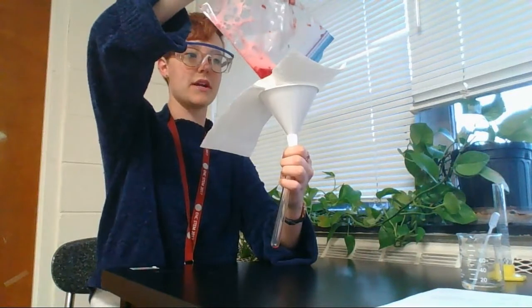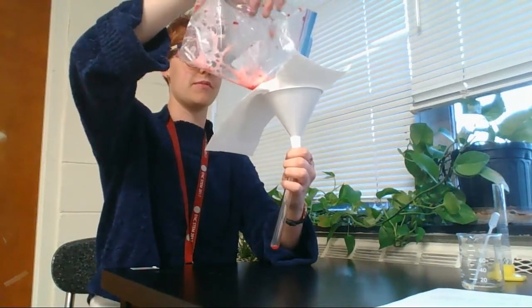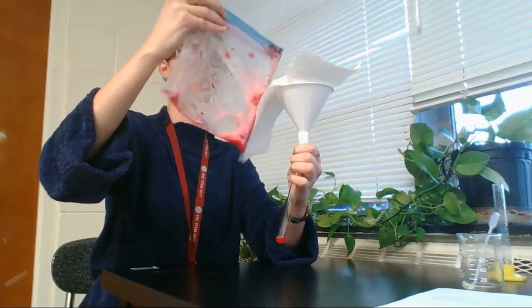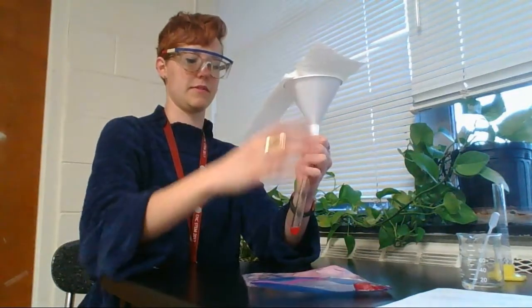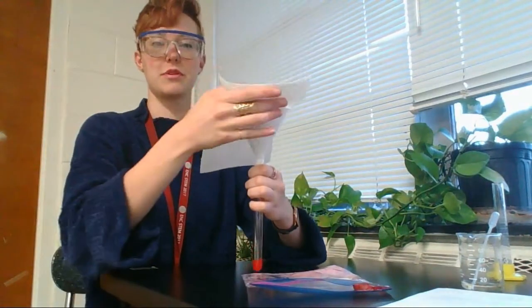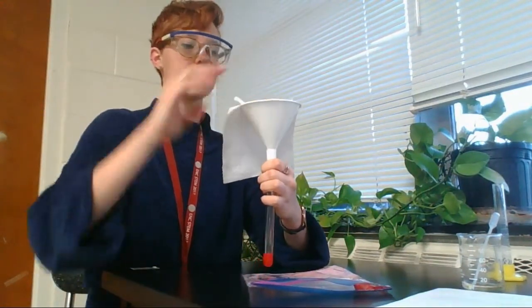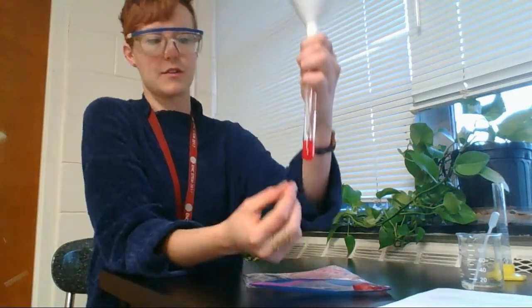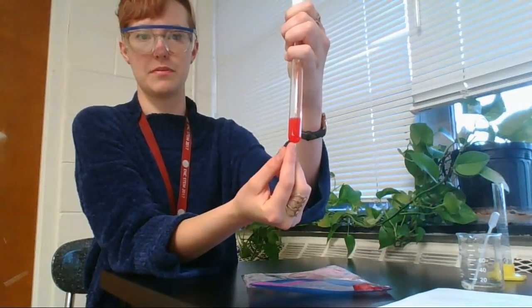You want it to stay on top of your paper towel. Now, for the purpose of this video, I'm not going to pour all of it on top because I don't have a partner. You can already see that I've got some strawberry fluid going into my tube, that's really good. We're using this paper towel right here as a filter. We want as few chunks in here as possible.